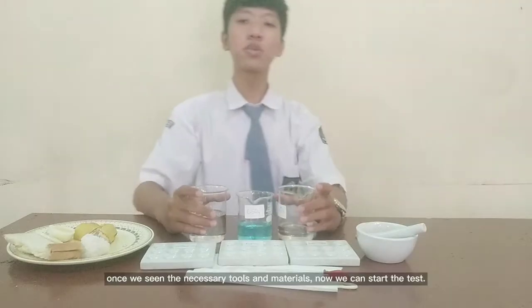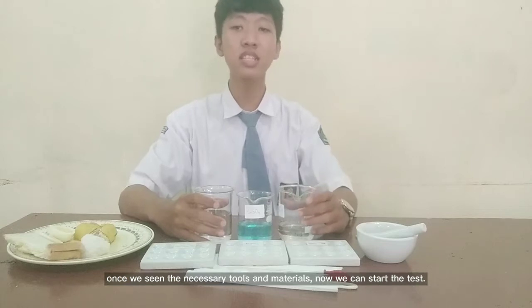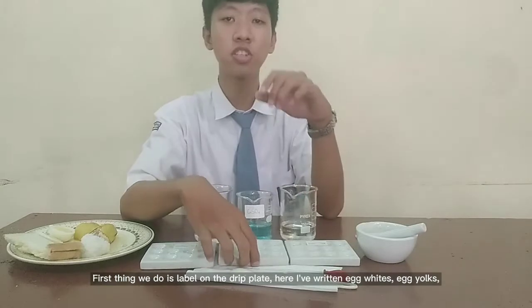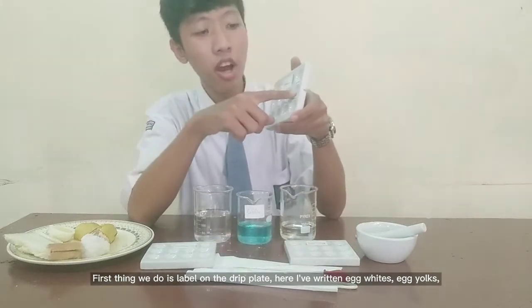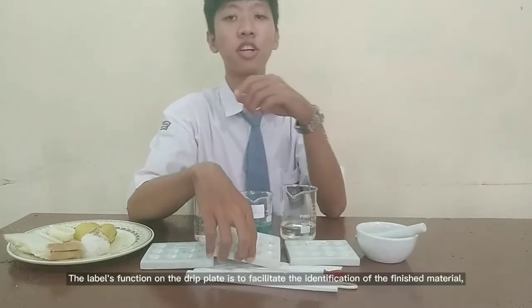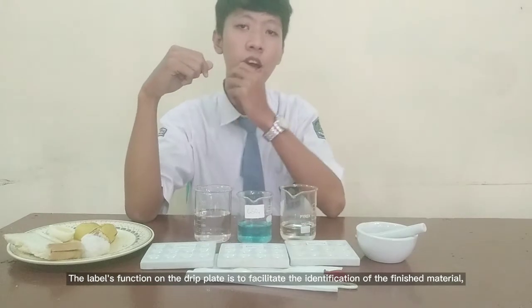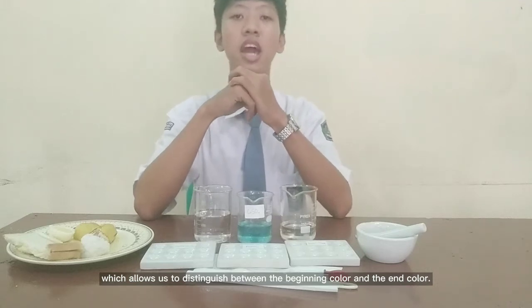Okay, once we see the necessary tools and materials, now we can start the test. First thing we do is label on the drip plate. Here I have written egg whites, egg yolks, bananas, bread, potatoes, and rice. The label function on the drip plate is to facilitate the identification of the finished material, which allows you to distinguish between the beginning color and the end color.